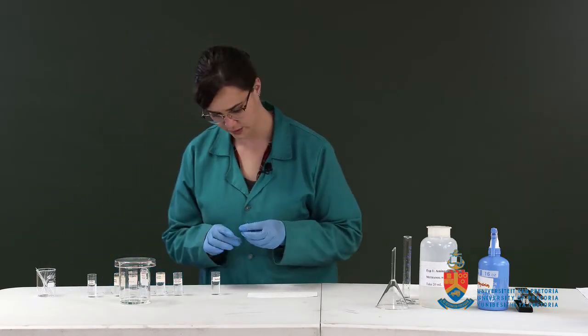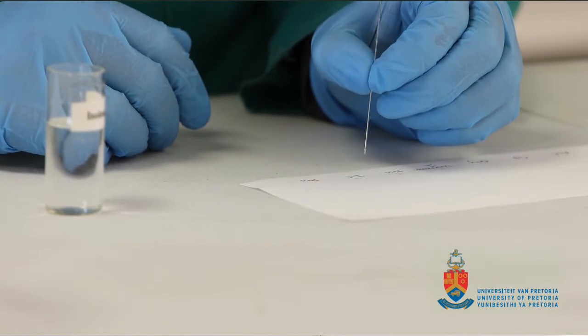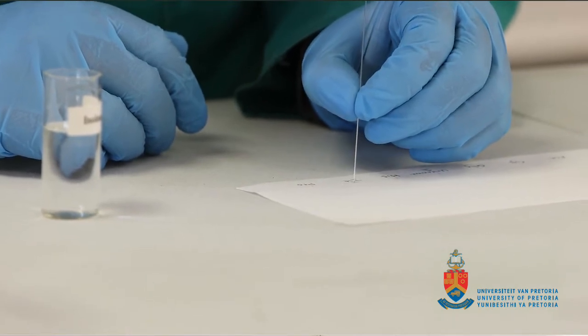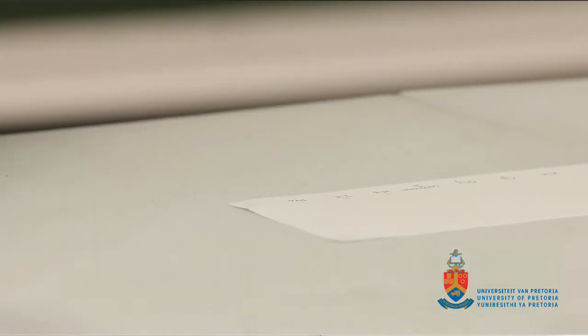We repeat with isoleucine. And finally with proline.